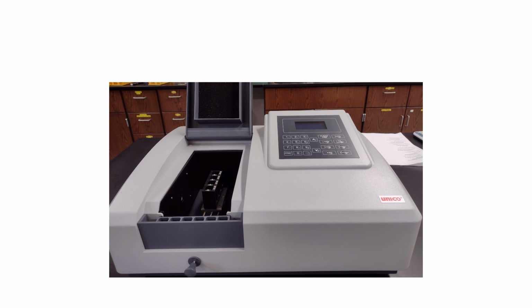Remember, bacteria, when they grow in a liquid media, they turn it turbid or cloudy. So the basic premise or idea behind this is that the more bacteria growing in a broth, the cloudier it's going to be, which means the less light is going to pass through. Now this machine, we can take a couple of different types of readings. You can do what's known as percent transmittance. That's how much light actually passes through. So if you're measuring percent transmittance or percent T, you would expect the more bacteria, the lower that number is going to be.